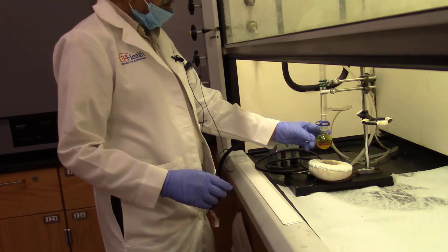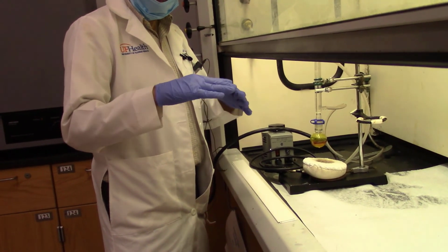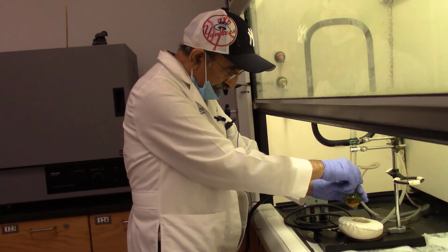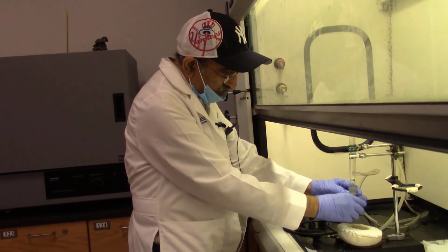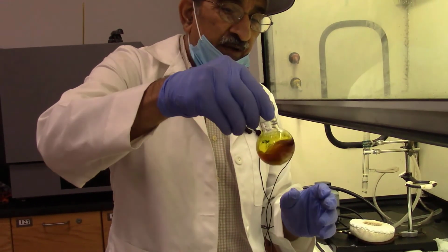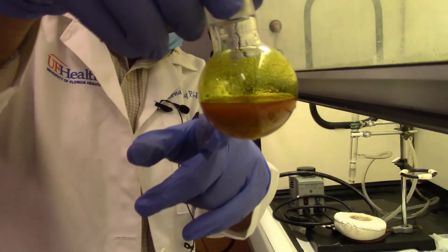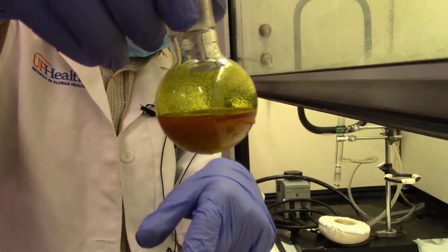Okay, I have been refluxing this solution for about 5-6 minutes. The purpose was to convert a very fine precipitate into a coarse precipitate containing bigger particles, because I knew I could not filter fine particles. So a lot of people try to actually heat it in some solvent to coagulate smaller particles into bigger particles. Now you can see the precipitate there.